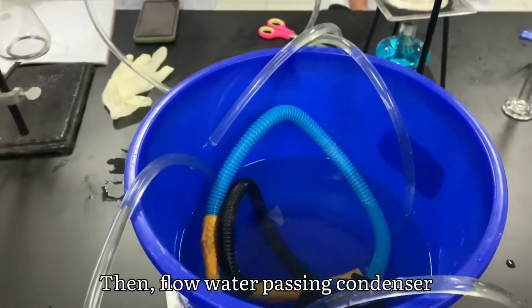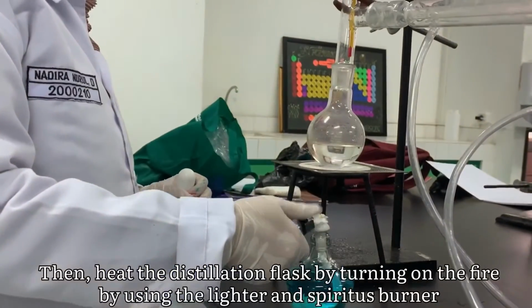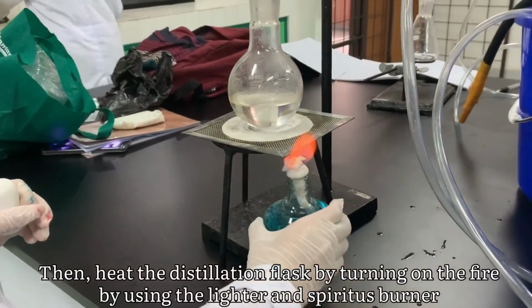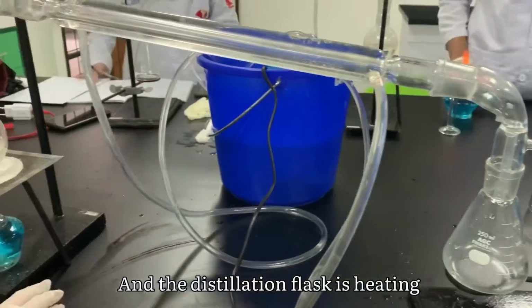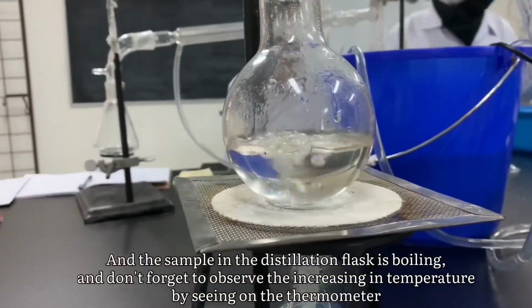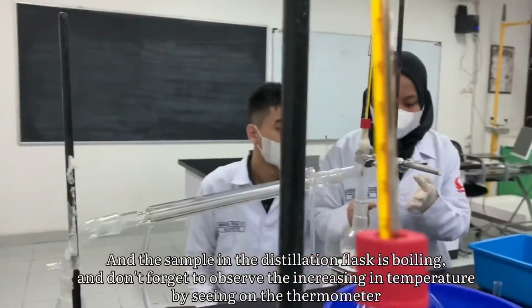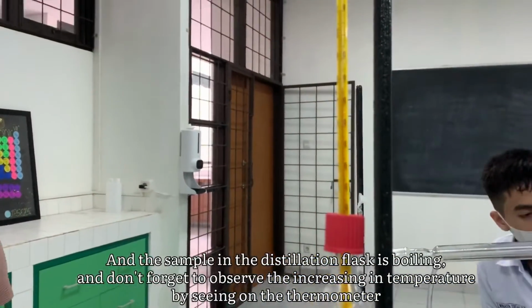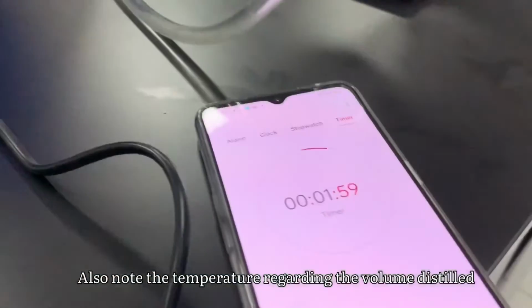Then, flow water passing the condenser. Then, heat the distillation flask by turning on the fire using the lighter and spiritus burner. And the distillation flask is heating. The sample in the distillation flask is boiling, and don't forget to observe the increase in the temperature by looking at the thermometer. Also note the temperature regarding the volume distilled.